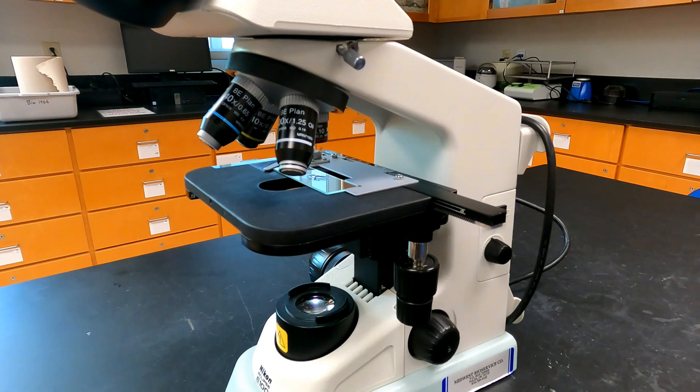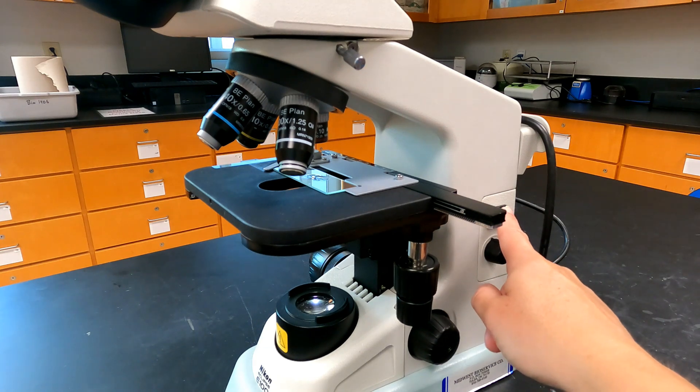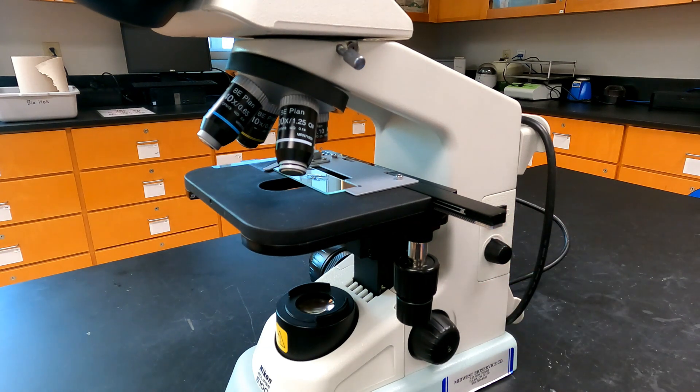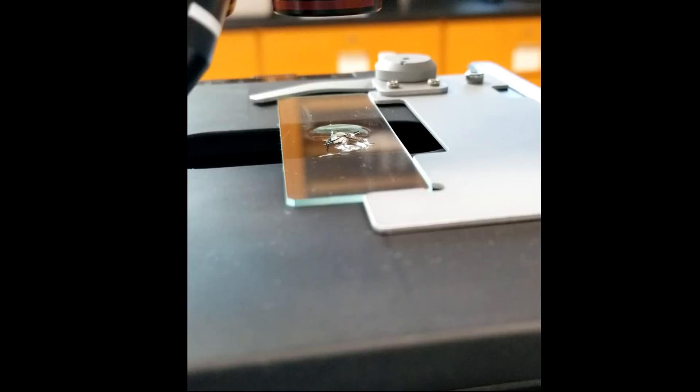While doing your calculations, turn off the microscope light to let your Daphnia rest on the slide in its drop of water. Once you are ready to test the effect of your assigned chemical, caffeine or ethanol, obtain the first test solution you have decided to try.